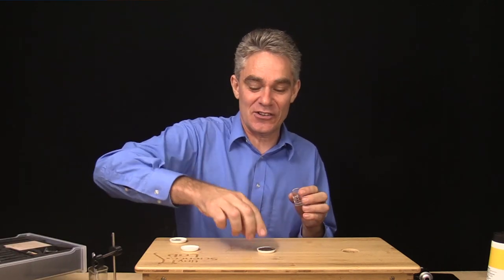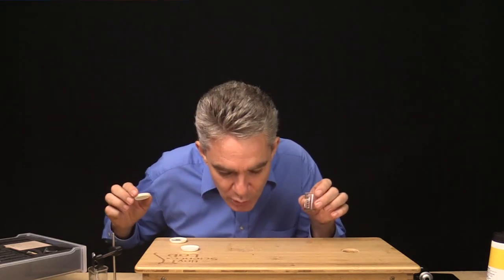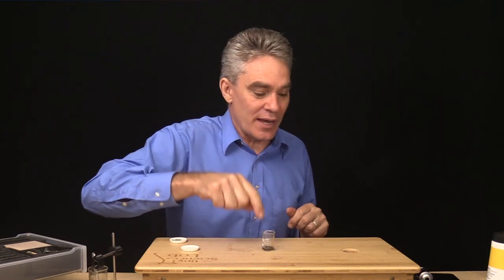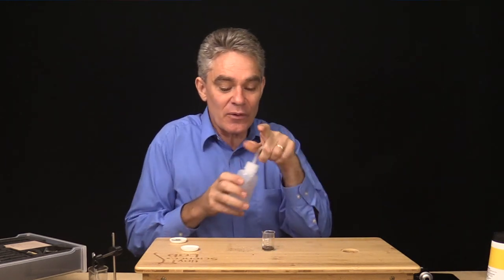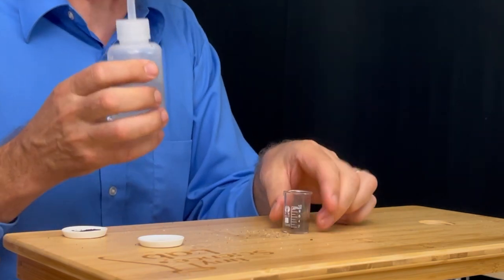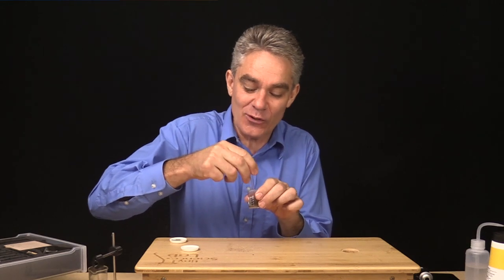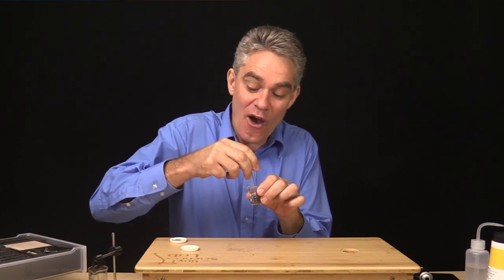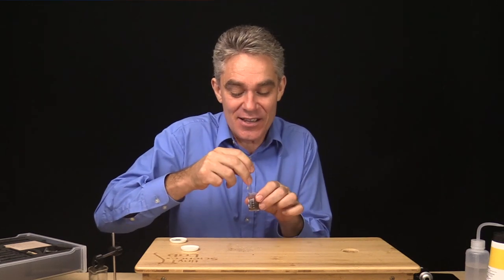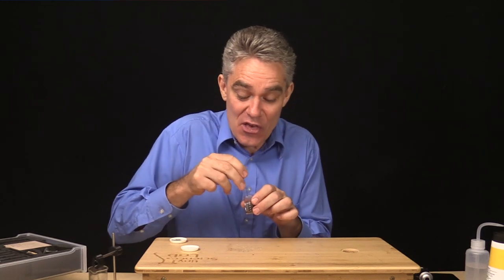Well I need to do some dissolving. I pop the sand and salt mixture into my beaker and I'm going to add some water, because water dissolves the salt. So now I've got some salty water and some sand.